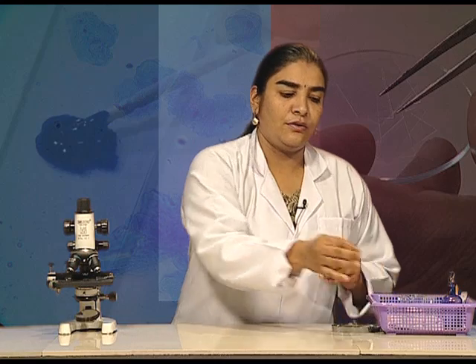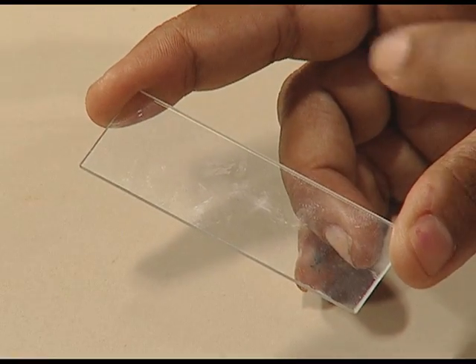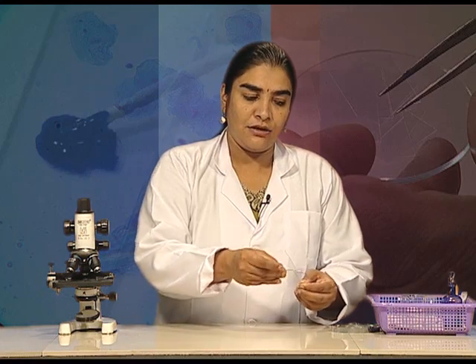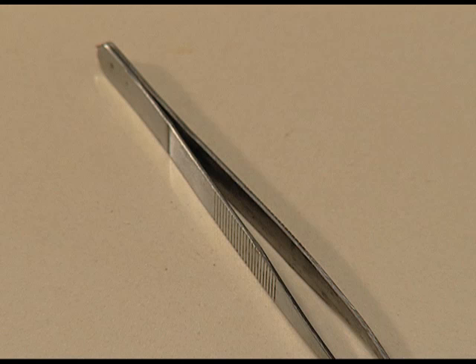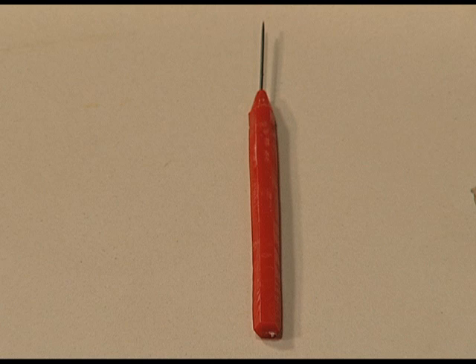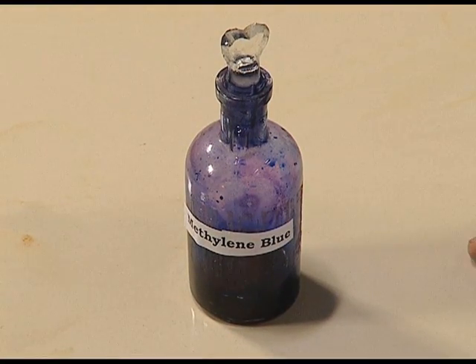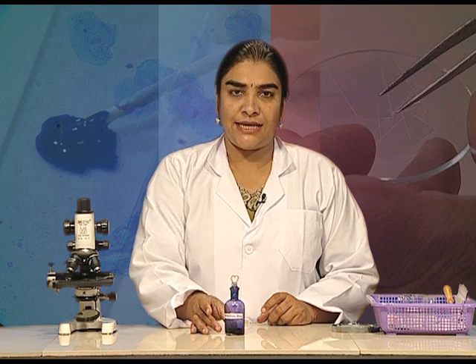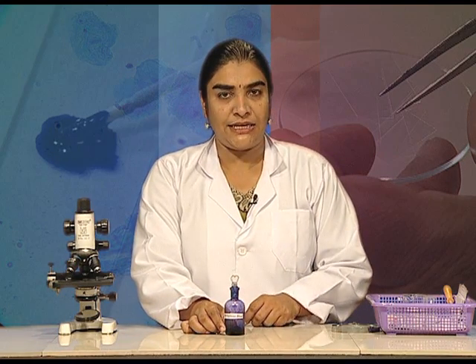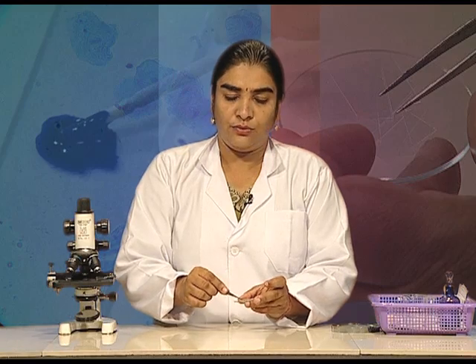Let us see what we need for making this temporary mount. We need a slide — it should be clean, and hold it only by its edges so it does not get dirty. We also need a dropper, filter paper, toothpick, a forcep, dissecting needle, water in a beaker, and a stain to colour the cheek epithelial cells. Here we use methylene blue, because it can easily stain the outer covering or cell membrane of the cheek epithelial cells, and a cover slip.